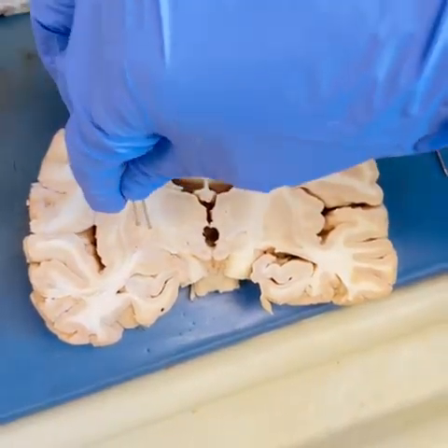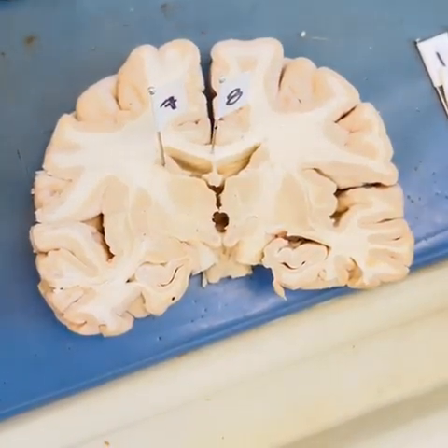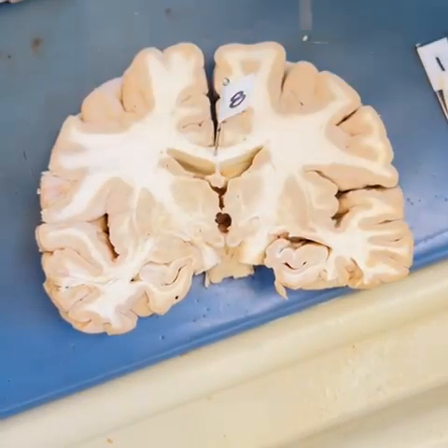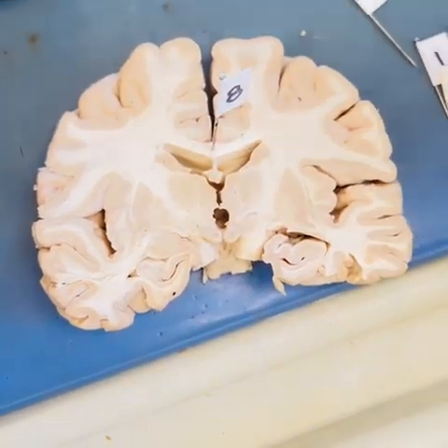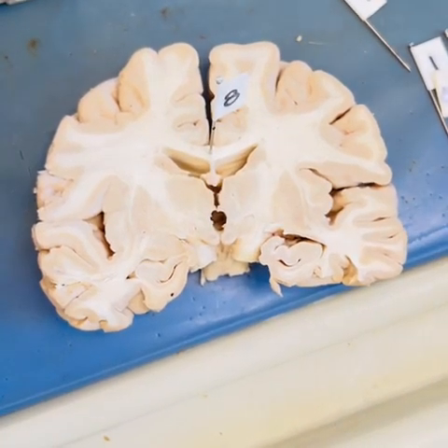Five and six are the putamen and globus pallidus, respectively. They're involved in regulating our body movement. Seven is our caudate nucleus, which helps regulate the movement of our mind and eyes, mostly when we're thinking unconsciously.